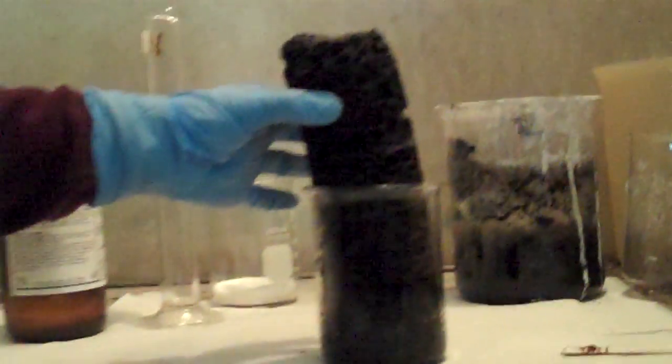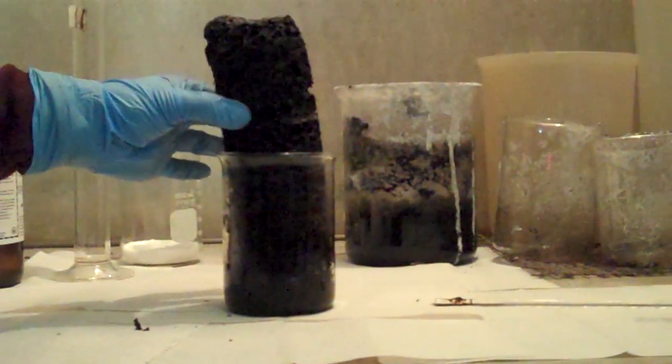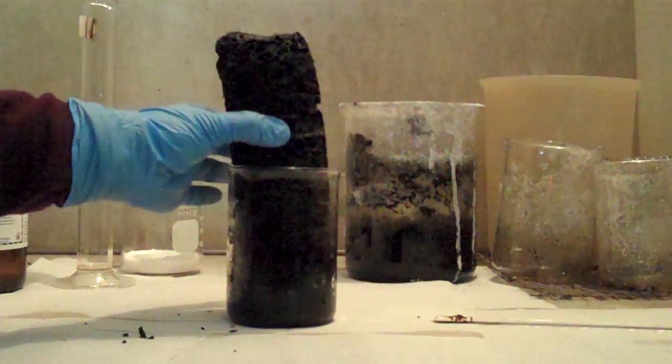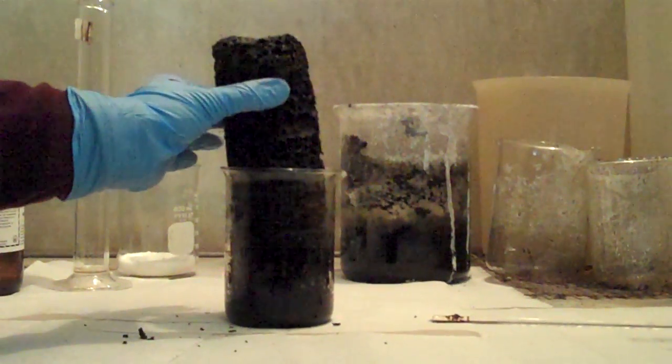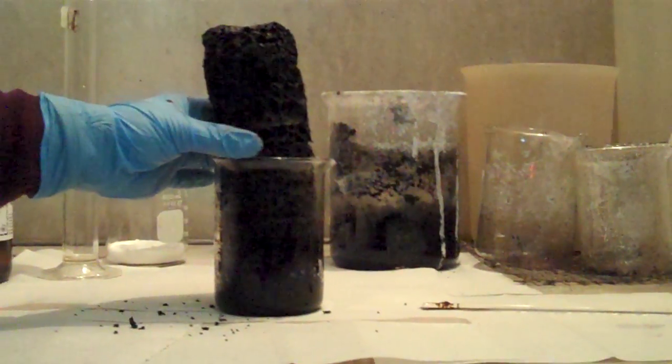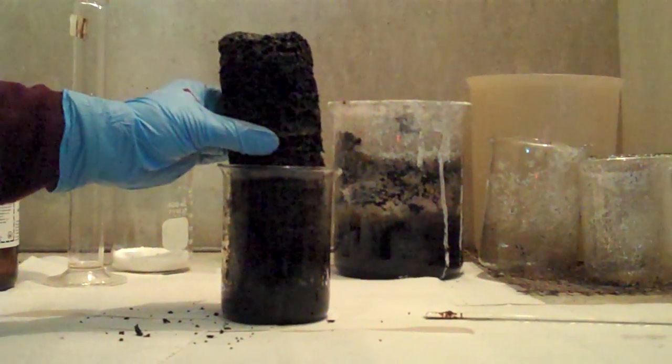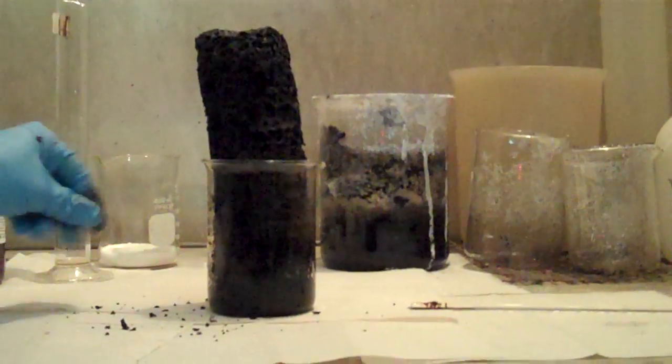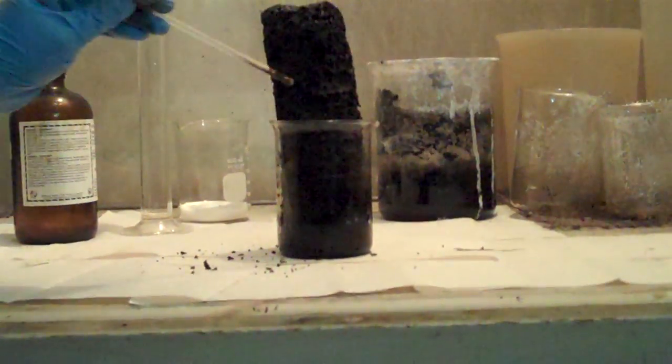Is the coal actually solid? Is it solid? Yeah, it's solid. So if I just kind of crunch it, it just kind of flakes away. And all that bubble is from the boiling water. Will it burn? You should lift it up. I can. And actually I will. Once it cools down, I'm going to take it out as a column. So it's called a carbon tower. Nice. What are you going to do with it?